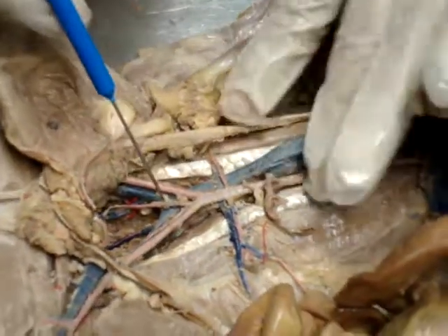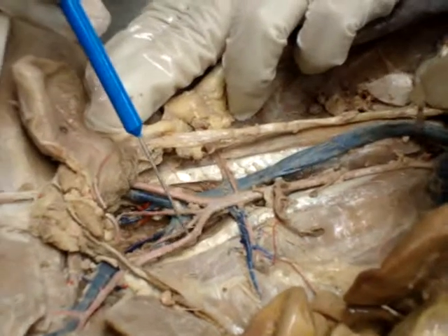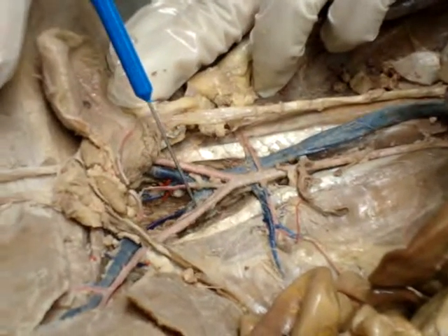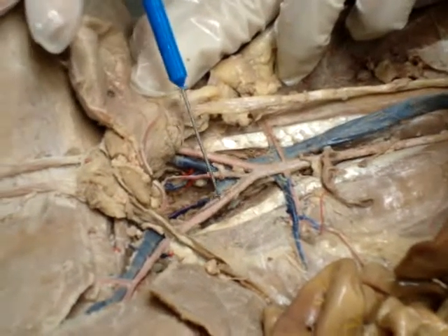Going down more, this would be the external iliac artery. This one is the internal iliac artery.